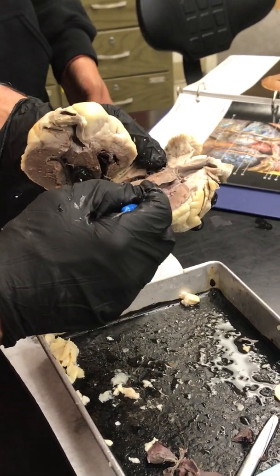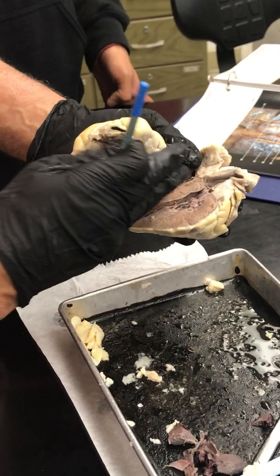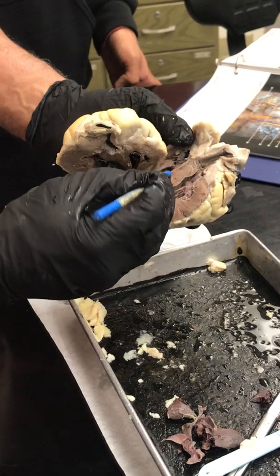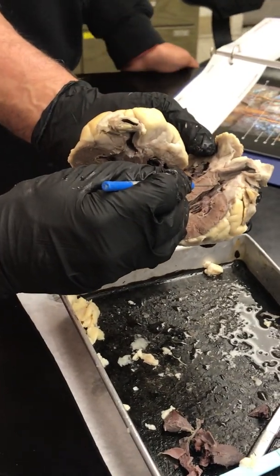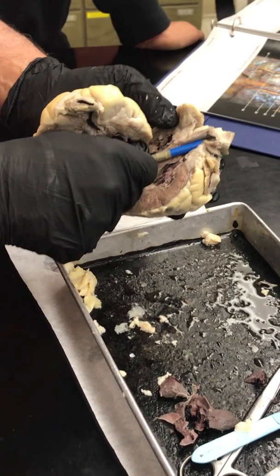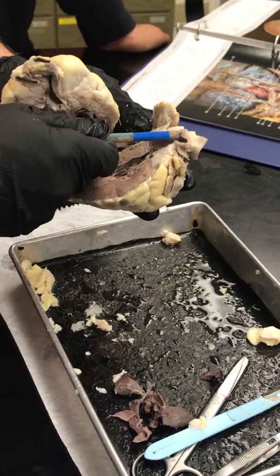Blood will fill in to the left ventricle and make a turn and come back up and travel along this and past this valve, which is also a semilunar valve. This is called the aortic valve, into the aortic arch. Once it gets into the aortic arch, it's going to go a couple of different places.